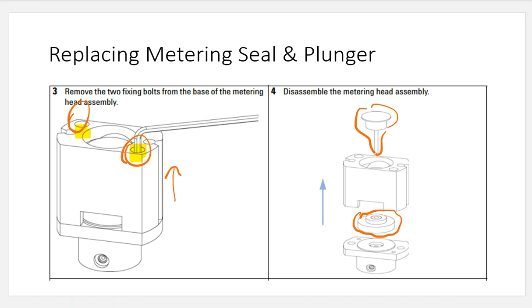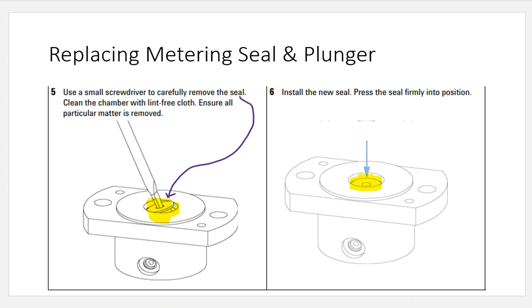So the seal is going to be down here on this round circle part that kind of pokes out to you when you look at an LC in person. Well, that is the piece that's going to have your pump seal in it. So I'm going to go here and zoom into that area. And just like the pump, I'm going to see a seal that's going to be here on the inside. So that seal is going to be just like the other times.